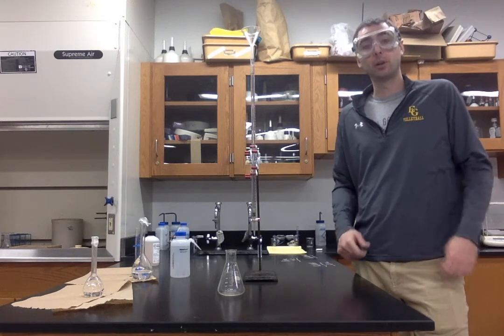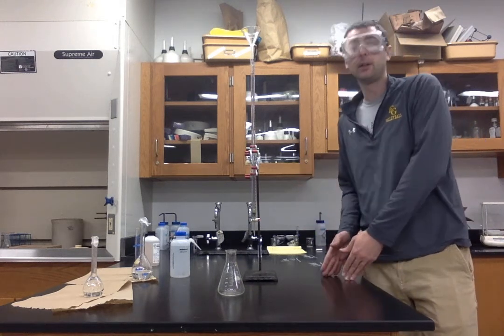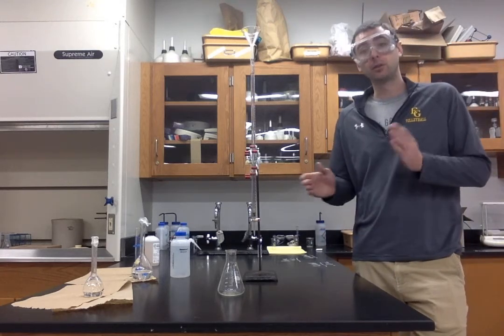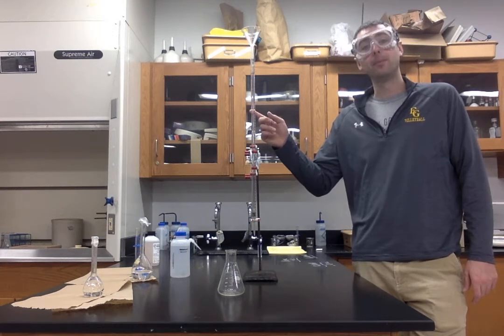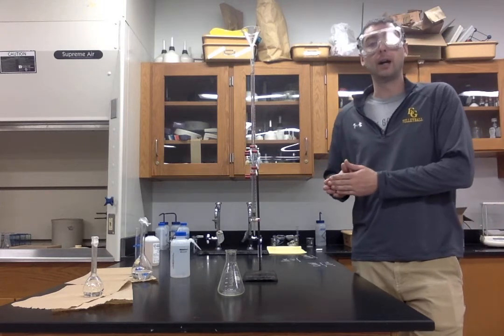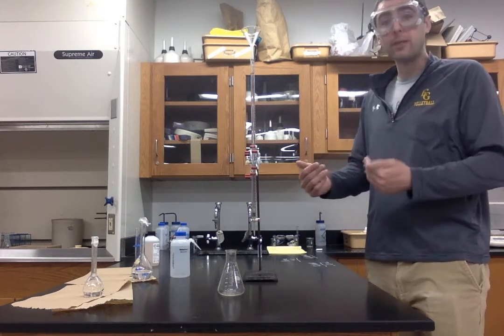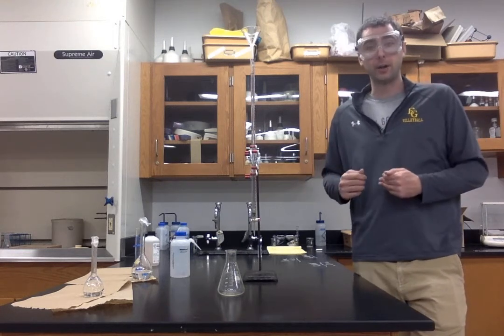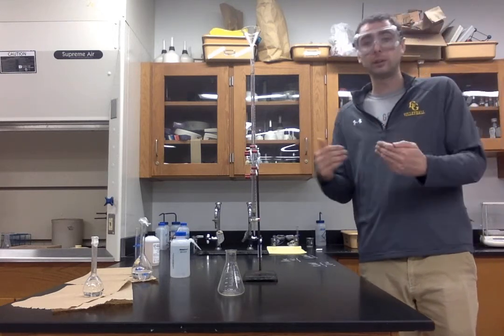Now, looking at your balanced chemical equation, you're going to see that the amount of moles of sodium hydroxide reacted will be equal to the amount of moles of hydrochloric acid reacted, as those two substances react in a 1-to-1 mole ratio. So if I'm able to figure out how many moles of sodium hydroxide reacted, I will also know how many moles of hydrochloric acid reacted. Ultimately, our goal in the first part of this experiment is to determine the concentration of our unknown acid. So we have a method for how we are going to get the amount of moles of acid reacted.